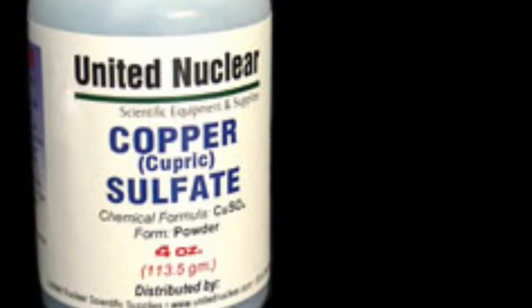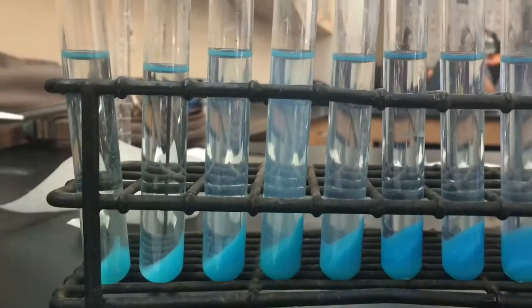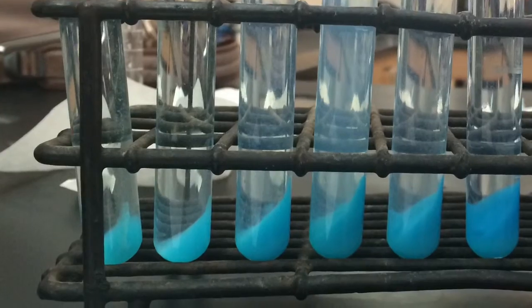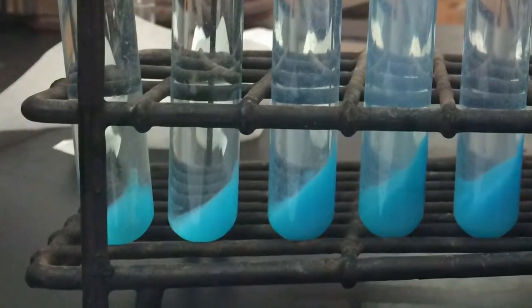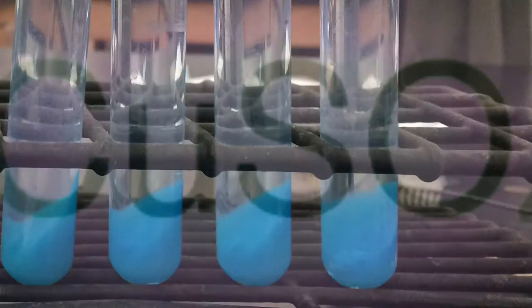Since copper sulfate is a constant amount throughout, the precipitate is increasing when we add more KOH in test tubes 1 through 4, so we can assume it is a limiting reactant and is making the changes. In test tubes 6 through 8, since copper sulfate is also constant throughout and the precipitate is not changing, you know KOH isn't contributing anymore to the reaction, so we can assume copper sulfate is the limiting reactant and is making the change. In test tube 5, there is no limiting reactant because both reactants are equally used.